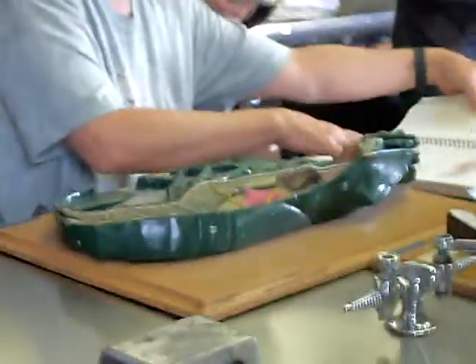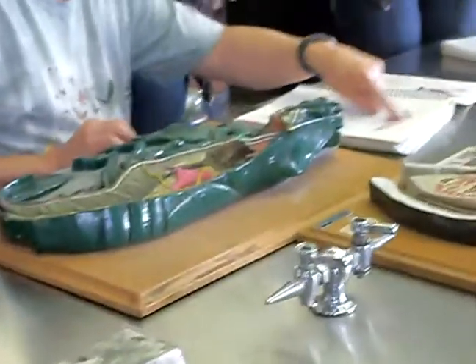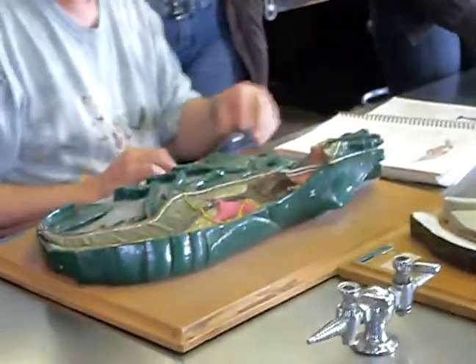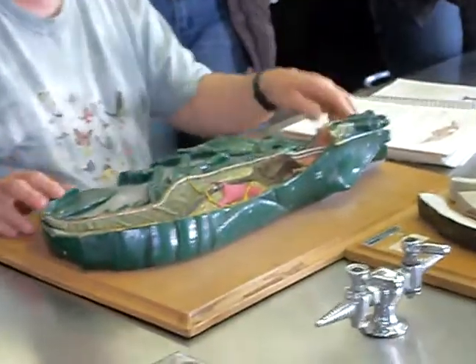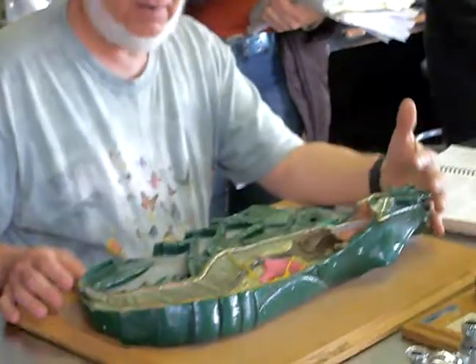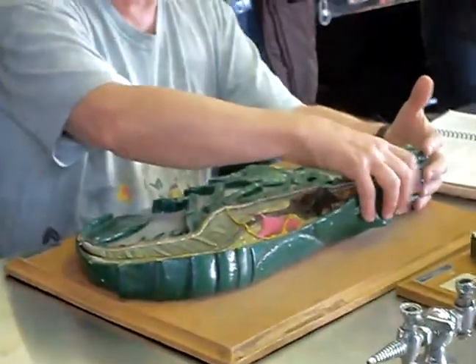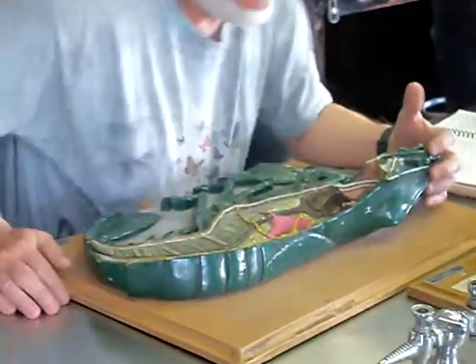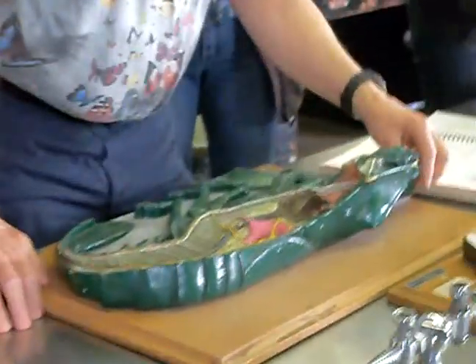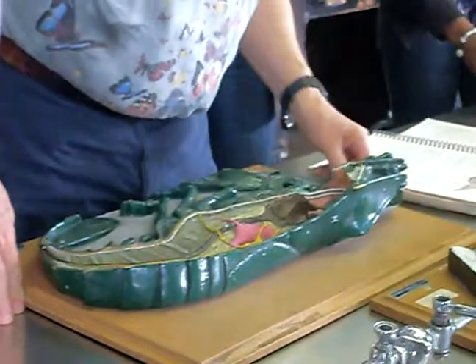These would be the external anatomy, the various structures, and this would be the internal anatomy. Let's do the external anatomy first. Starting with the head, we've got sensory structures called antennae.